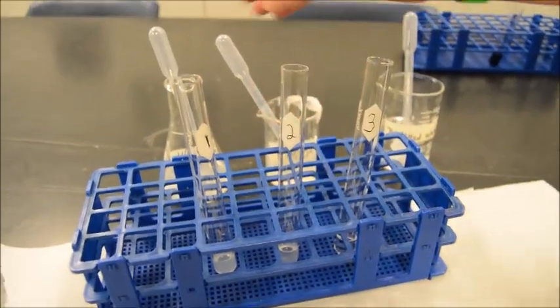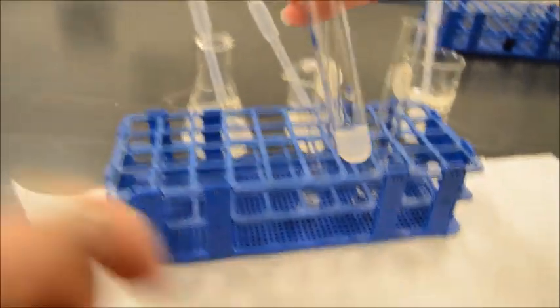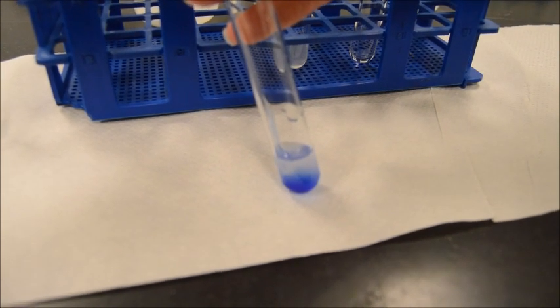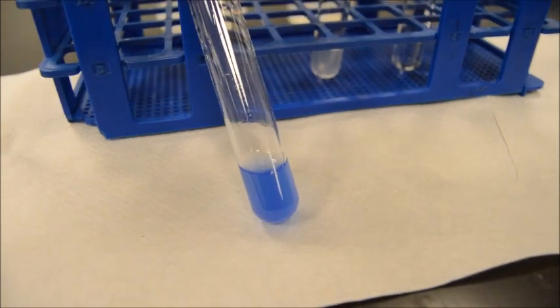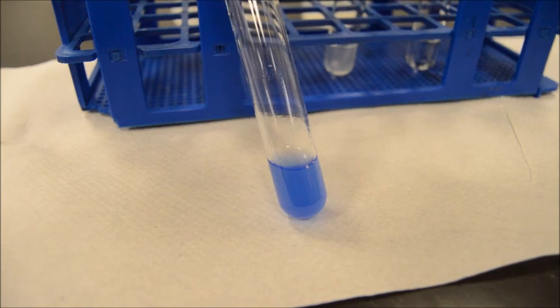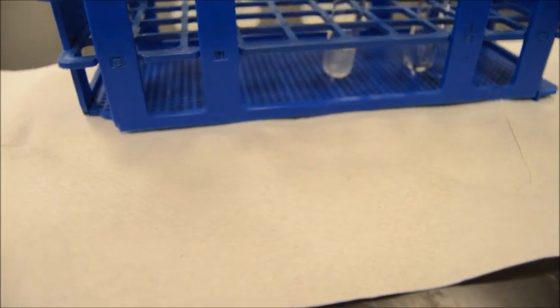All right, let's see what we got. Number 1, here's starch, our 10 drops. Over the white, now we can really see it. So you can see that there's kind of this bluish color going in. All right, so we need to mix a little bit. Swirl it. Here we go, perfect. Nice lighter blue, which is just from less fluid being in there with a clearish fluid. Same color. So I'm calling that negative.